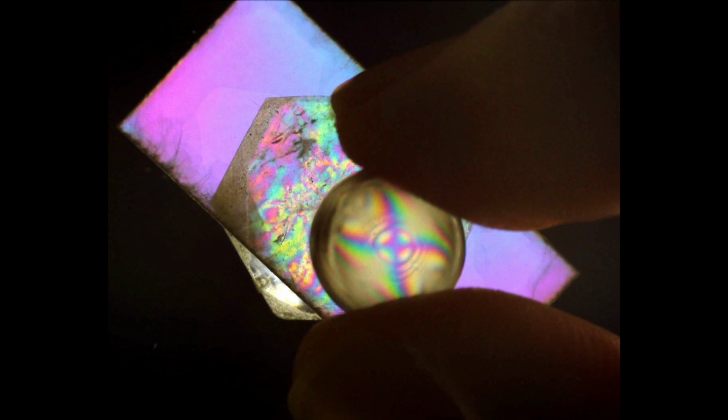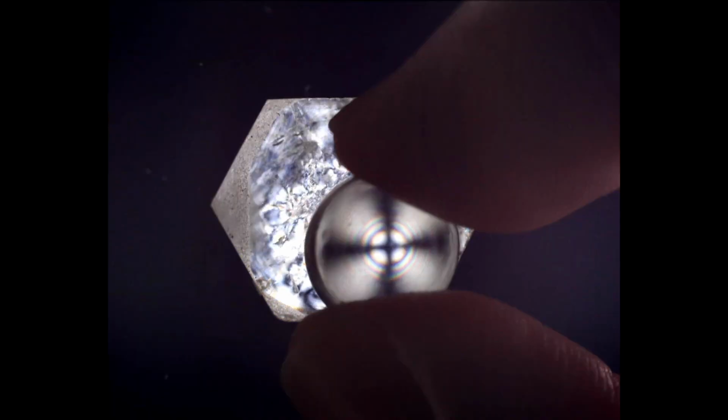In order to figure out what's going on here, we first want to go back to our uniaxial optic axis interference figure that we generated earlier with our beryl. We'll zoom in a bit here. And what I want you to notice when we transition to the image of our interference figure where the Muscovite plate is added is where do our interference colors add and subtract from one another. We'll do that transition a couple more times.